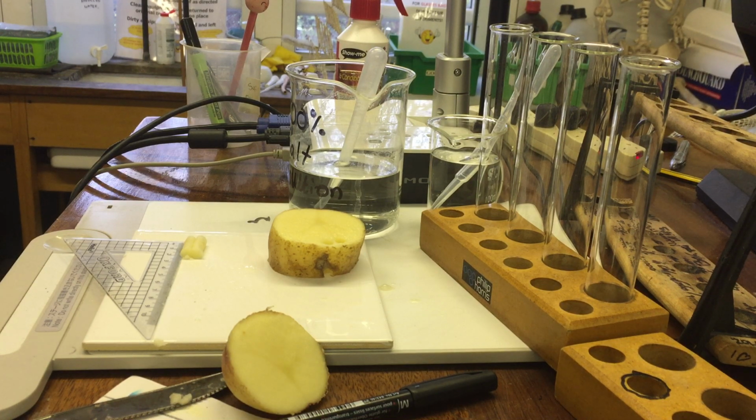Take a paper towel, put them all on the paper towel, go to the scales, one by one, place each one on the scale, weigh it, find the mass, write the mass on the paper towel next to the potato chip. Okay? And that way you will know which mass of potato chip is going into each tube. Now that's one person's job. So one person's job will do that.